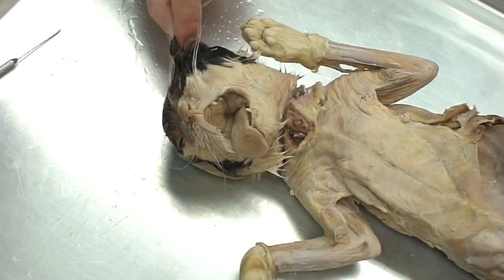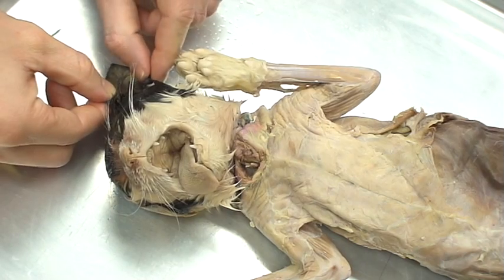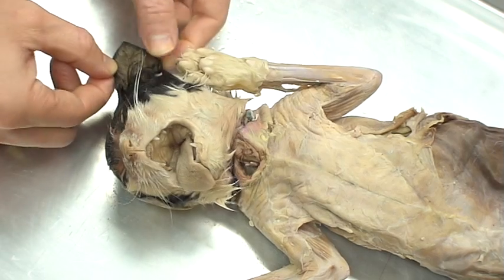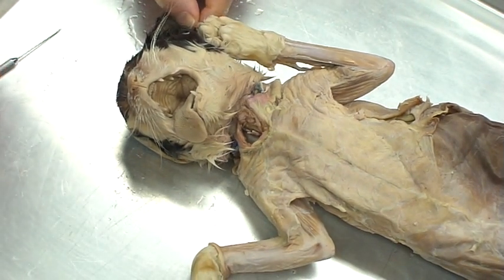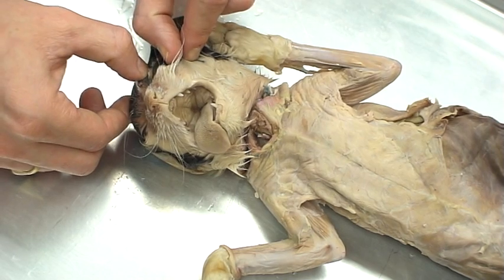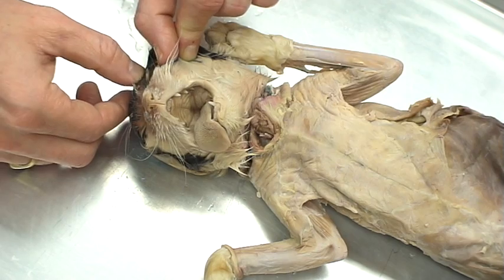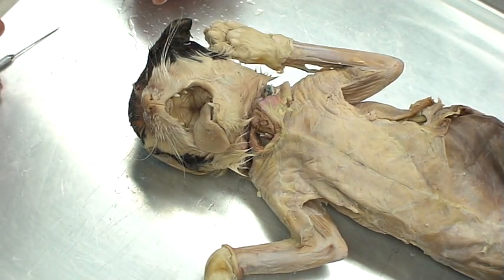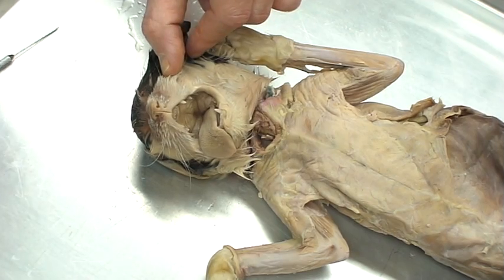First we're going to look at the ear flaps. Cat ears are set up a little differently than ours — they're able to rotate them to locate sounds, unlike humans. The ear flaps are called the pinnae, and they're specialized for sensing sound. The eyelids are set up just like in humans — we find two sets. The top one is the superior palpebra and the bottom one is the inferior palpebra.